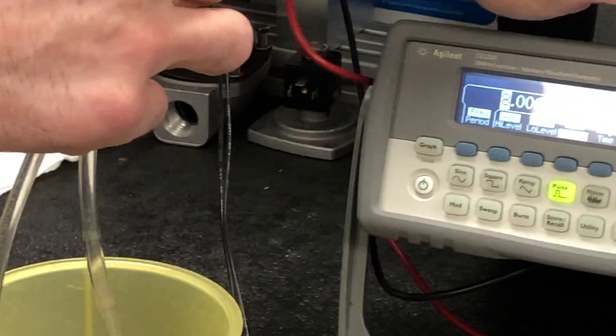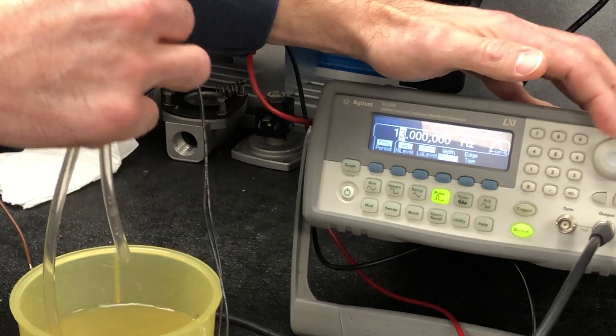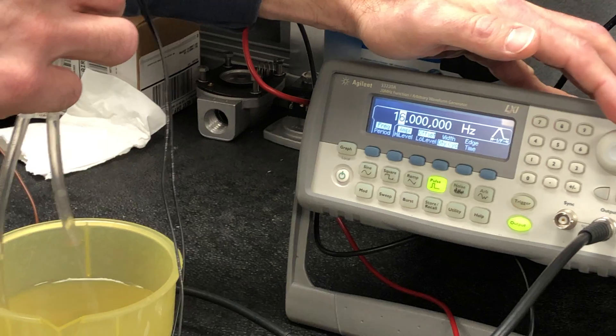You can crank it up a little more if you wanted to. This one's about 20ish. It's the quickest, you know.